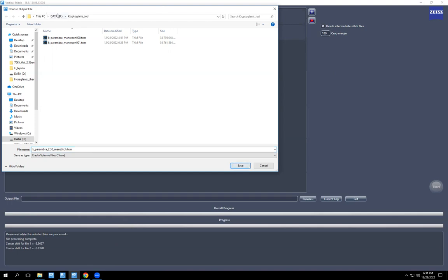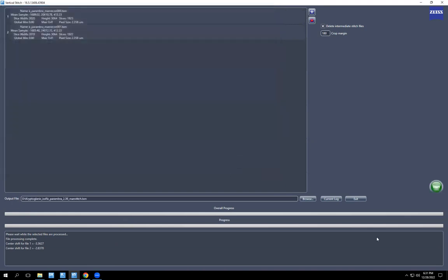Once again, I think you have to do this in the computer, not a hard drive. And then hit start, and it takes about 30 minutes for a 3-part scan and maybe 25 minutes or so for a 2-part, maybe 20 minutes. And this will go on for a while, and you will have your stitch. The end.